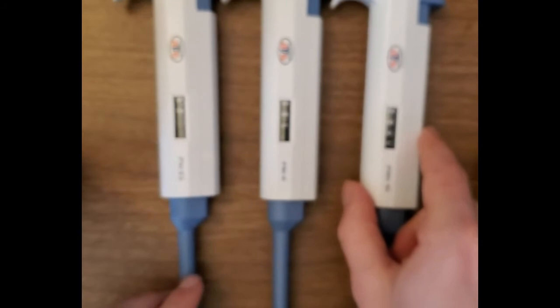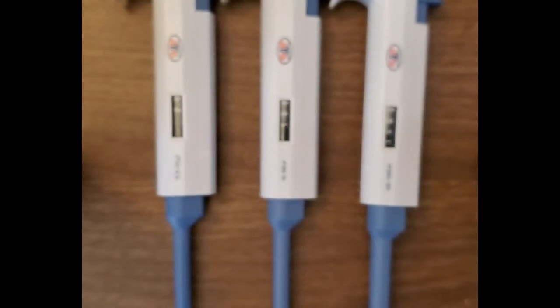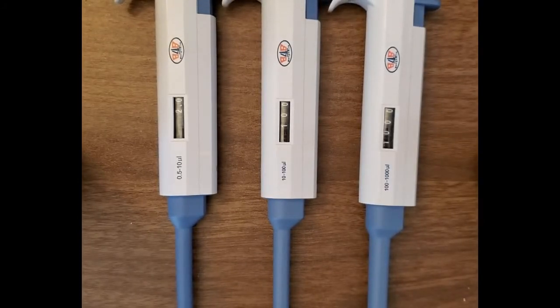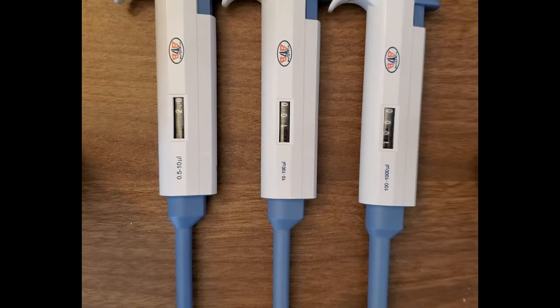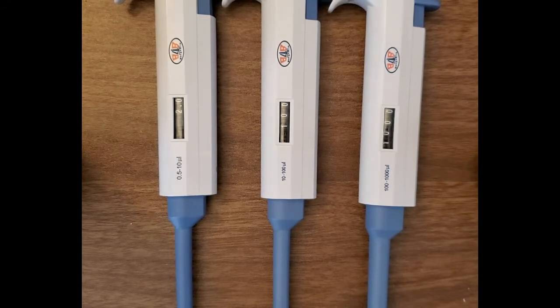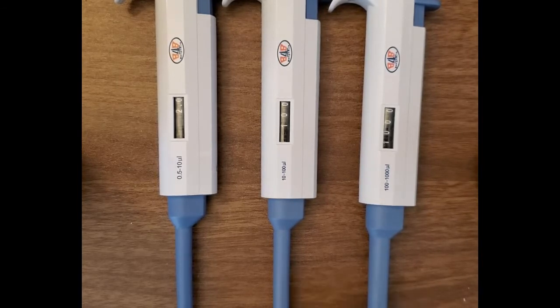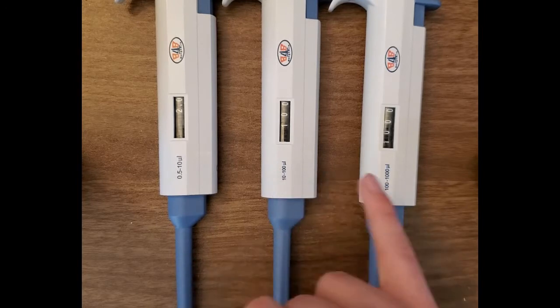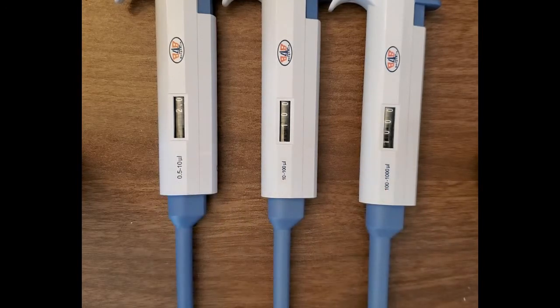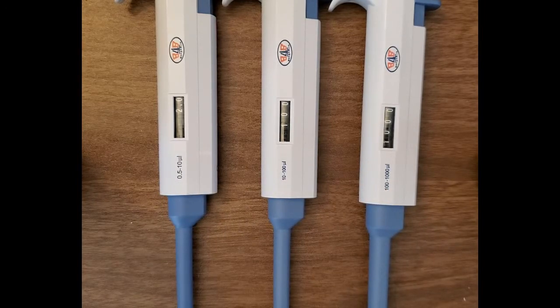You also need pipette tips to go along with it. You can find those pretty easily — just make sure they correspond to whichever volume range you have and you should be all set.